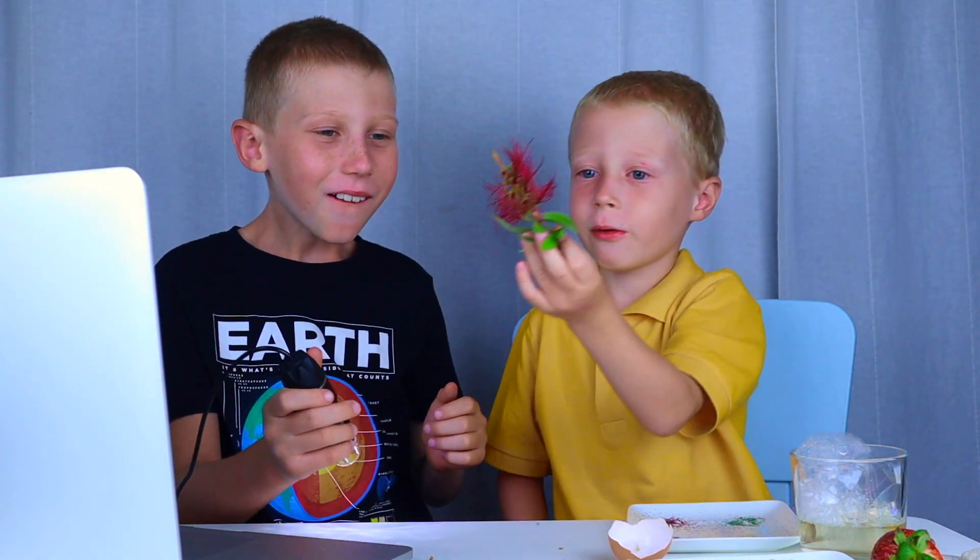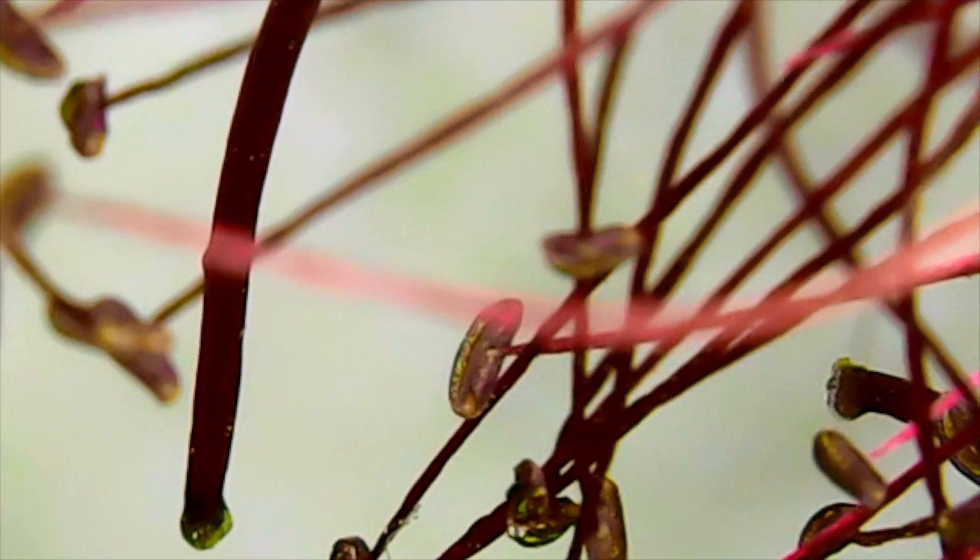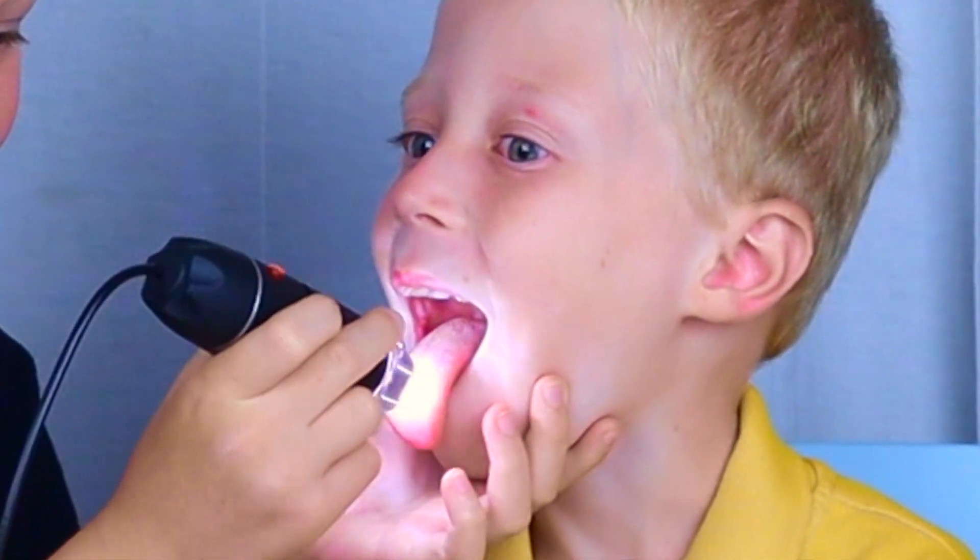Oh, the flower. Oh, amazing. Whoa! So cool.